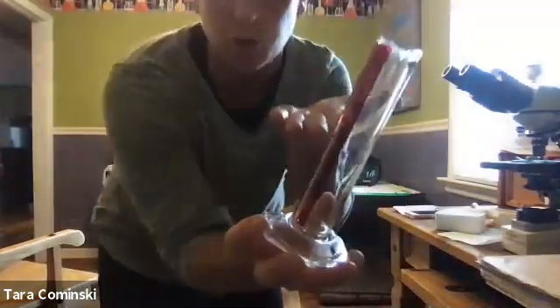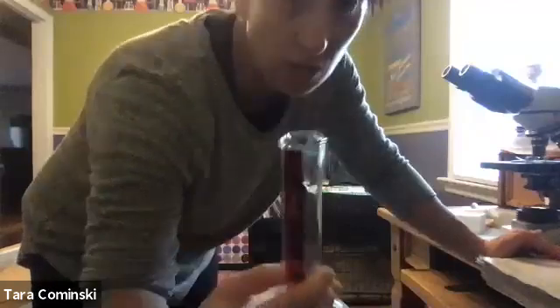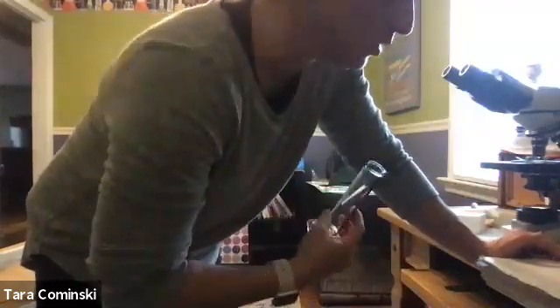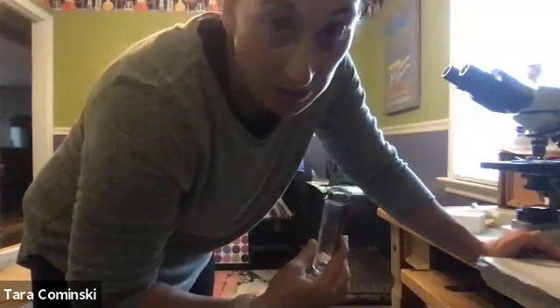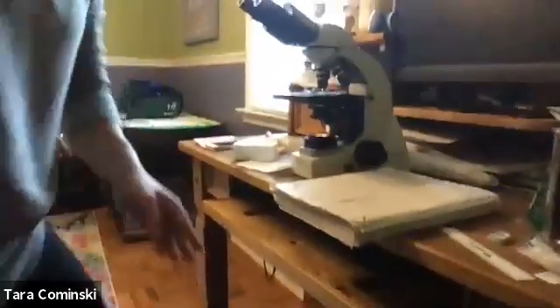So if we wanted to measure 20 milliliters, we would pour liquid in there to that 20 mark, okay? All right, so I was mentioning milliliters, right? So we can talk about liters and milliliters. There are 1,000 milliliters in a liter. It tells you that on the top of page 12. That's where we are now. So, experimental procedure for volume, okay?